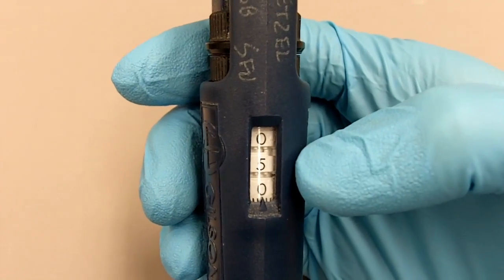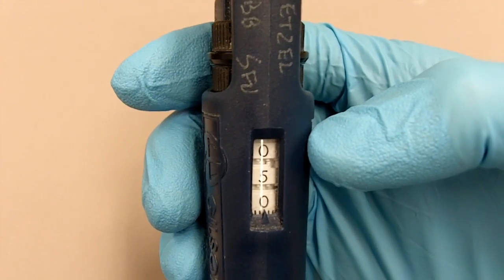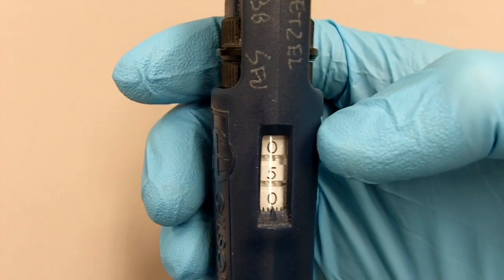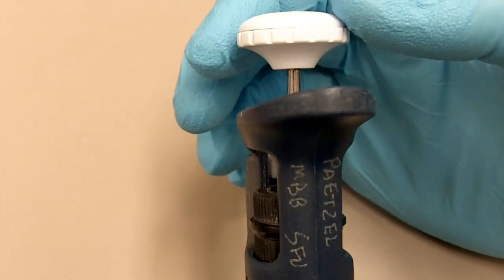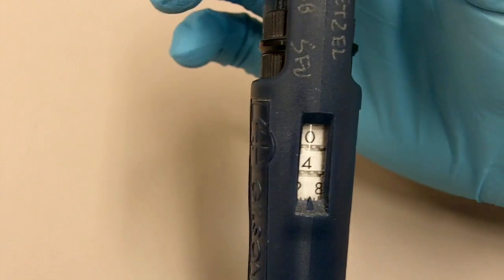So here you have the volume display right now sitting at 050, so this is 50 microliters. And then if we look at the knob on the top here, this is for volume control. So if I turn it, we can change the volume.